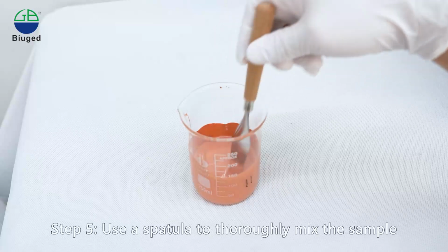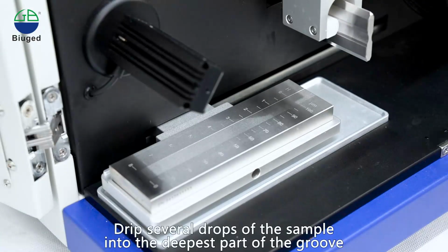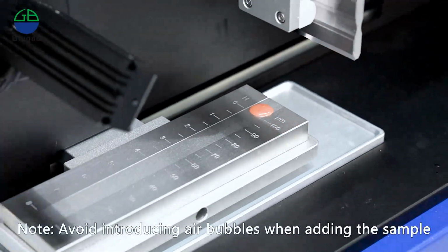Step 5. Use a spatula to thoroughly mix the sample. Drip several drops of the sample into the deepest part of the groove, allowing it to slightly overflow. Note: avoid introducing air bubbles when adding the sample.